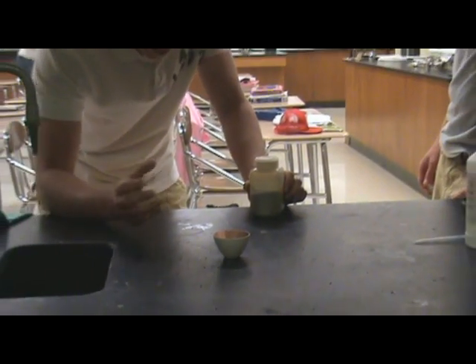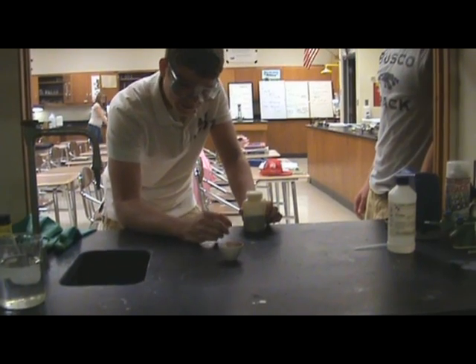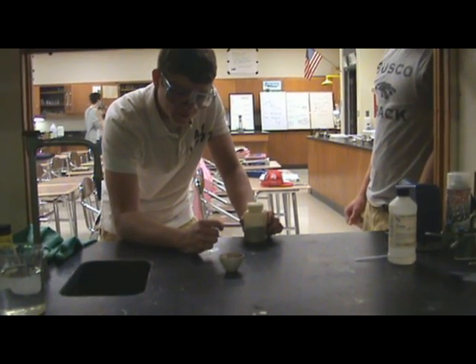This is an exothermic reaction, so obviously it's pretty hot, so it's not good to touch. So that's the reaction.